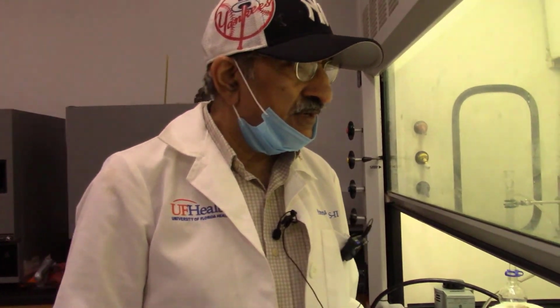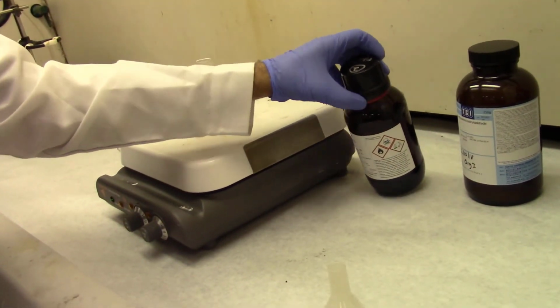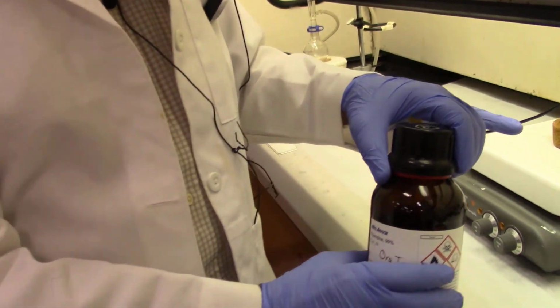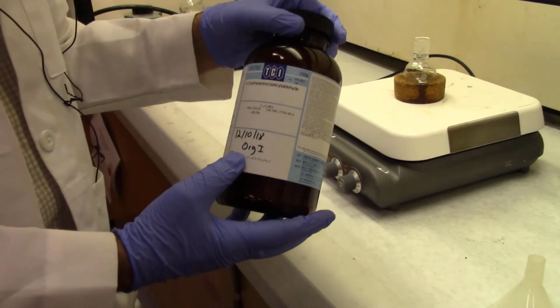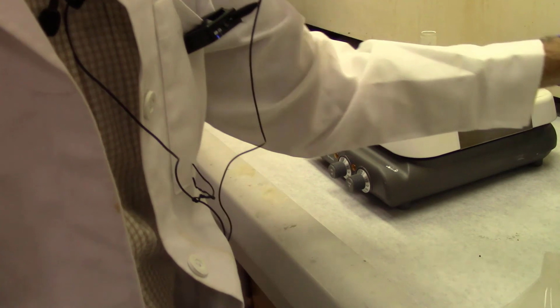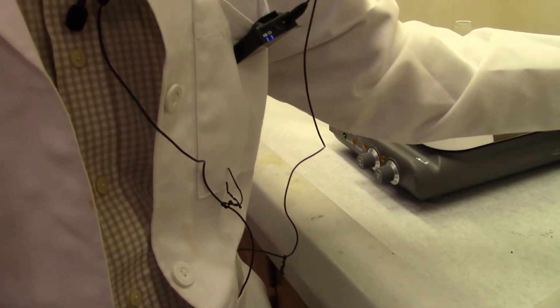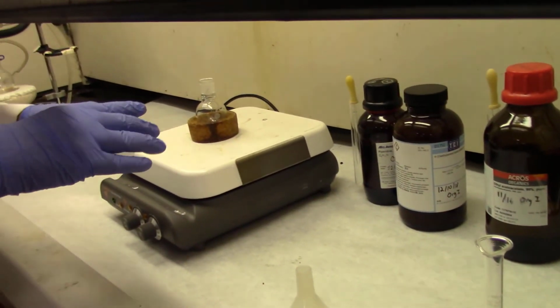Okay, we are in the lab, and let me introduce to you some of the chemicals that we'll be needing for this reaction. This is piperidine. It's a mild base, a secondary amine, that is required as a catalyst for the Knoevenagel reaction. Now this is N,N-diethylaminosalicylaldehyde. That's the carbonyl partner for the Knoevenagel reaction, and this is ethyl acetoacetate, the active methylene compound. Active methylene compounds have acidic protons that are removable by the mild base piperidine.